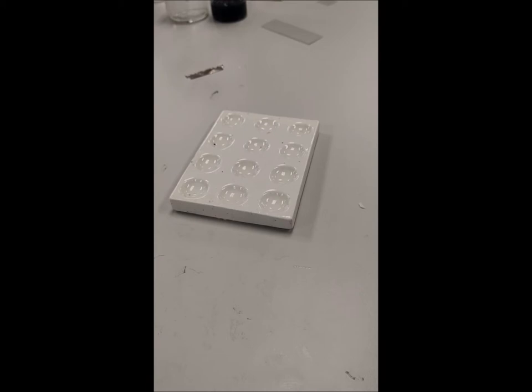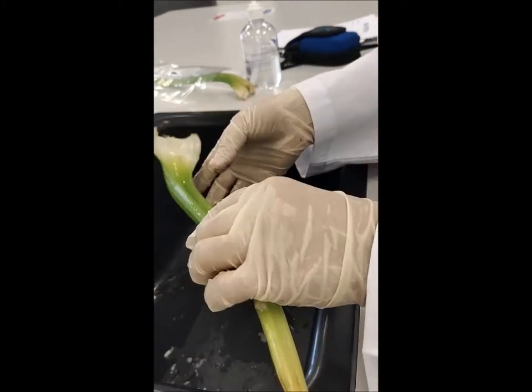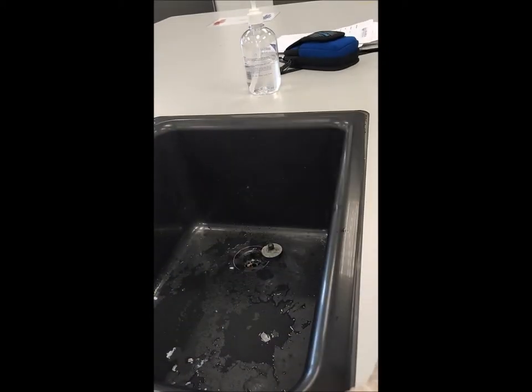The other sample is the plant tissue. I have selected celery, which is easy to work with. The first thing you have to do is wash the plant well. Once done, I get one small sample of it. We have to prepare very thin slices — as thin as we can. We don't have the proper cutter for this purpose, so I think using a razor blade would be much better.